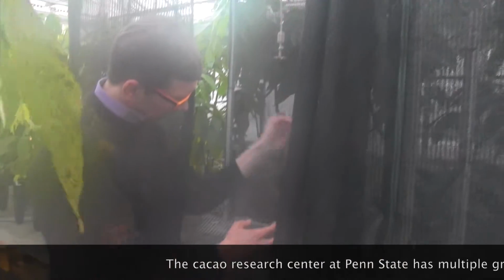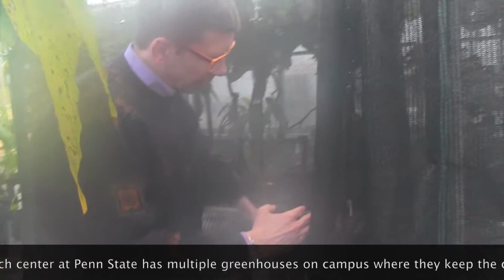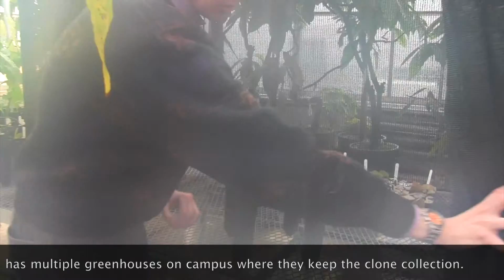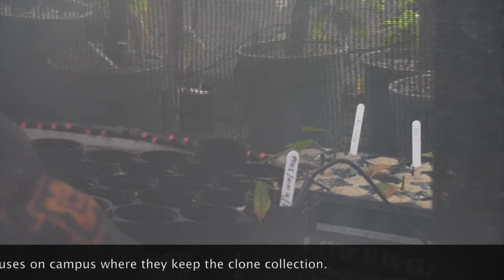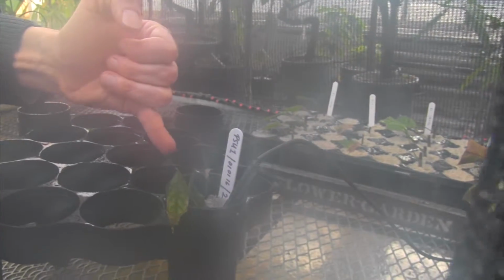Those small little plants are taken out. We bring them to this enclosure. Told you before, this is a couple weeks of reckoning. Hopefully, we're crossing our fingers that our plant will continue to grow. But you can see there's a meristem starting here at the top.